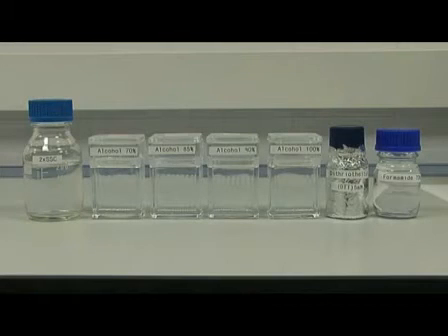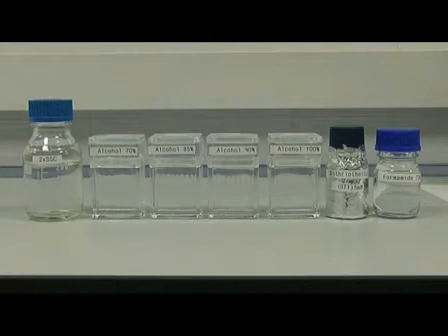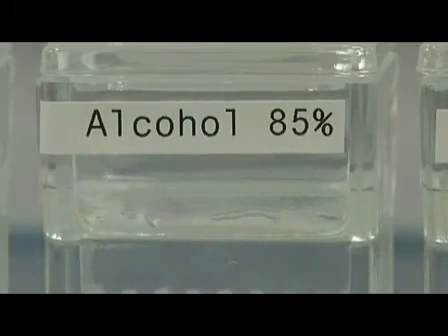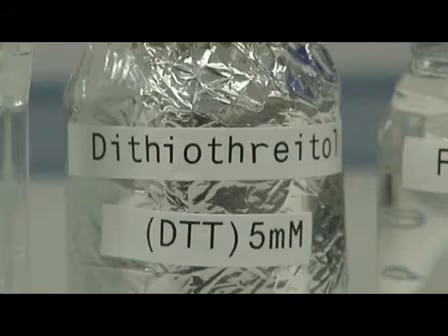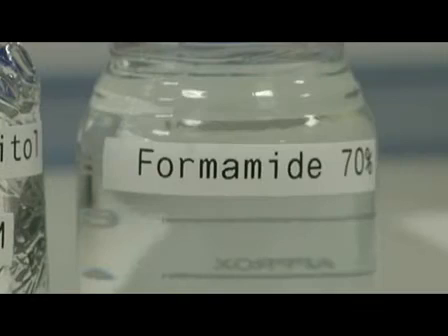In this part of the experiment, we are going to use saline sodium citrate solution, ethanol series, dithiothreitol and formamide.